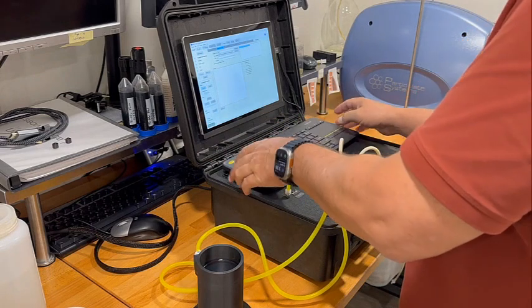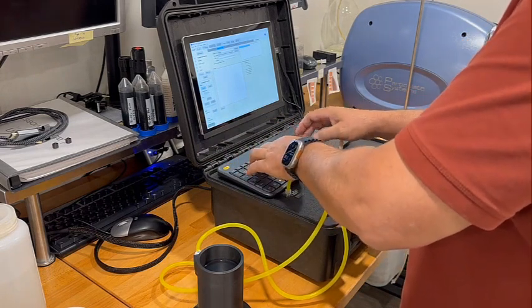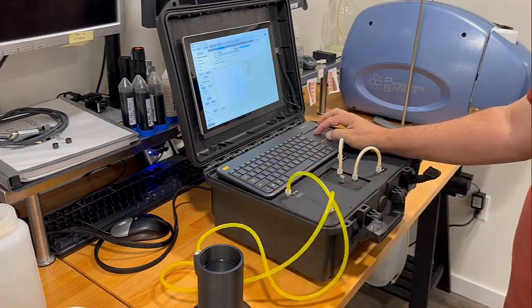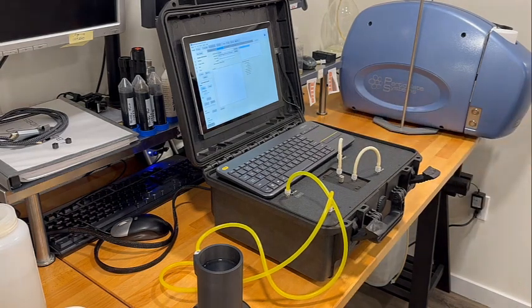of the portable, it does have a Microsoft Surface Pro as the computer, which is detachable, so you can work on your data offline after you do your analysis remotely. It also has, as you can see, an external keyboard and mouse that can be used when you're in the lab or just for ease of entering data. Can also be done touchscreen because the Microsoft Surface Pro is touchscreen.